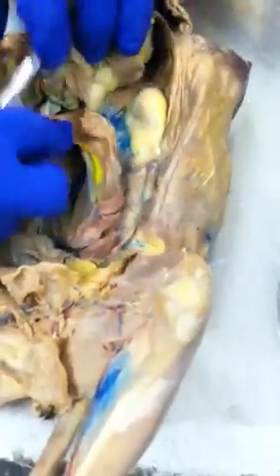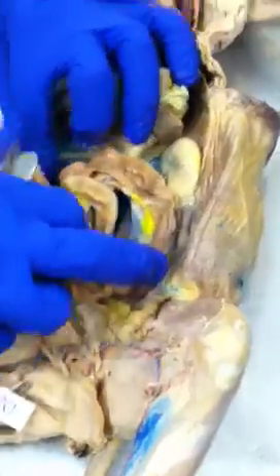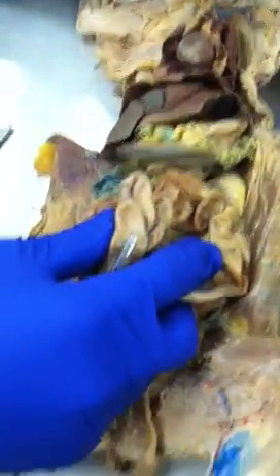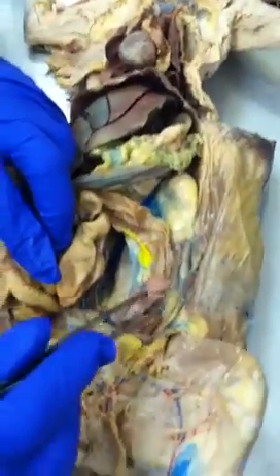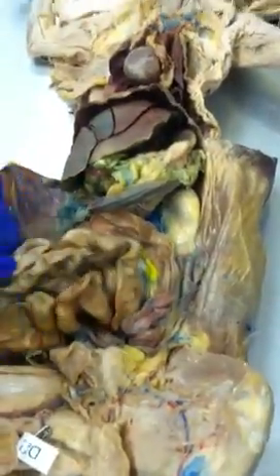We're now looking for the colon, right, the large intestine. So we could follow it from here. You see it? You see, all this is the large intestine here. It's curving into there. So we're going to look for it down here. So you see what I ended up doing? Because I couldn't immediately see this part, I started from the rectum area, because I know for sure this is the colon. You see what I'm saying? And then I followed it back up. You know what I'm saying? And I went around, and bam, I get it right here.